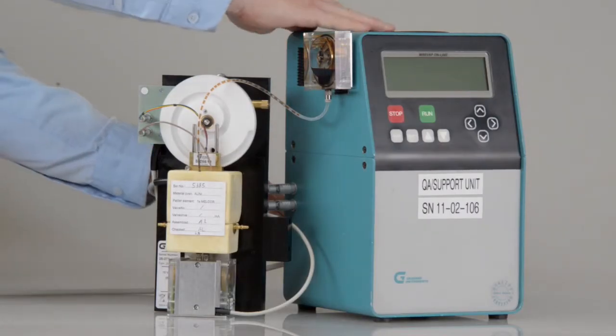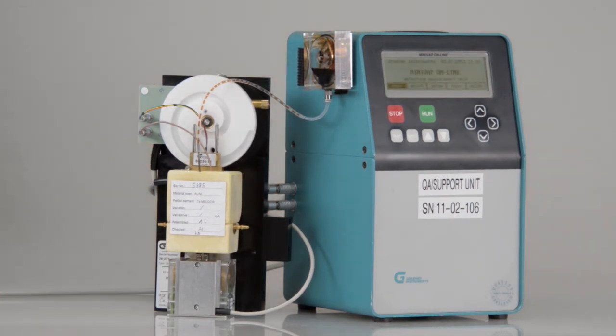For calibration, the measuring cell is easily attached to a service unit.